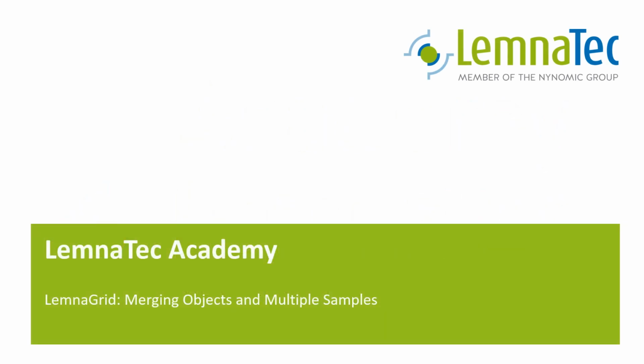In this video, I will explain what to do if your plant is not a single object after segmentation. In the second part of the video, you will learn how to deal with multiple plants in an image and how to evaluate them independently. Let's get into it.